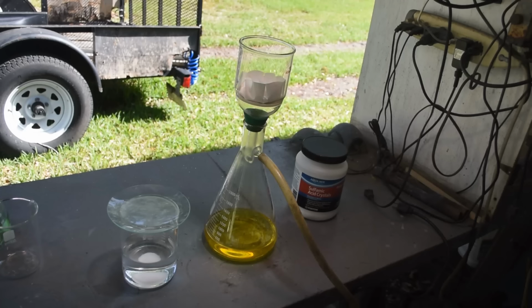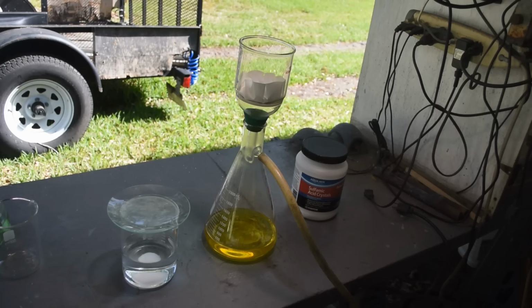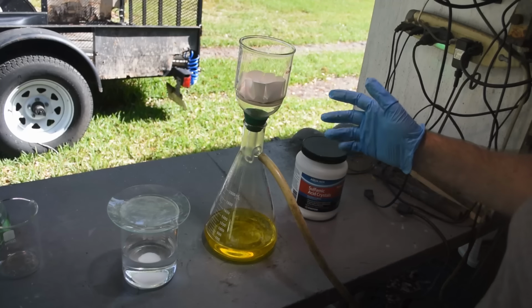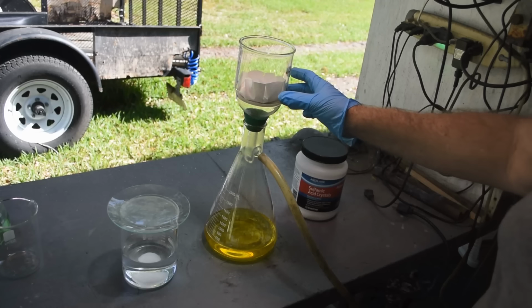So right about now, the battery in my Bluetooth microphone died. So I'll give you some voiceover on this segment. I'm explaining that this stuff has sat around since the night before because it was really late and I wasn't going to continue in the dark. So I just left it in the fume hood overnight, brought it back out, and we're going to denox it.